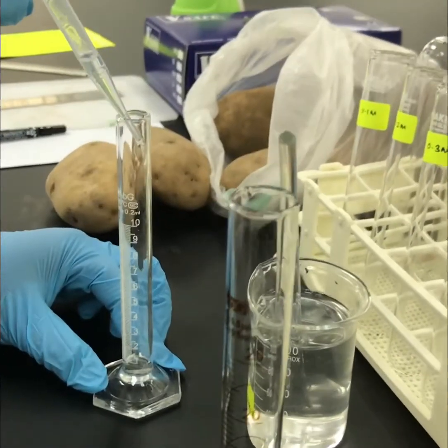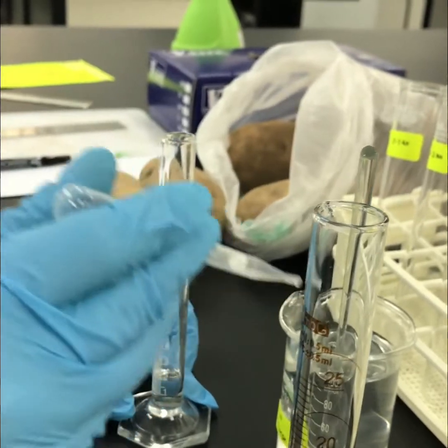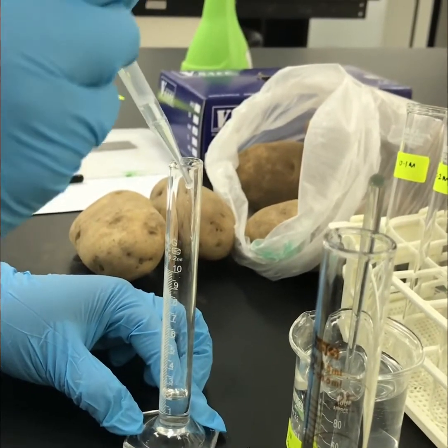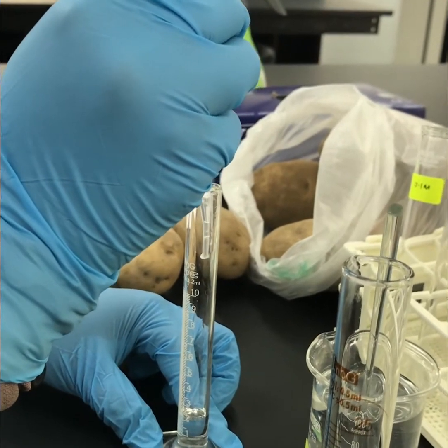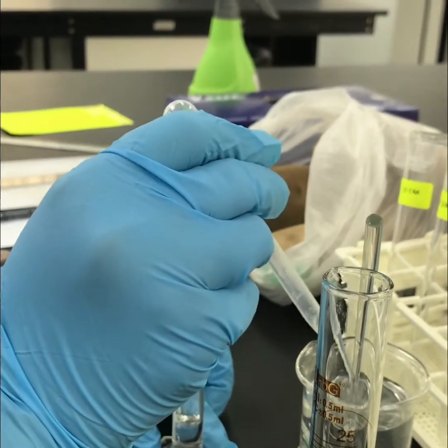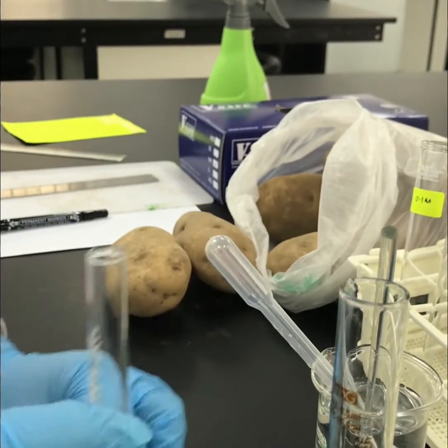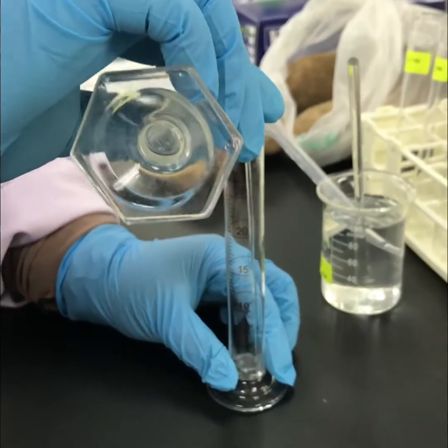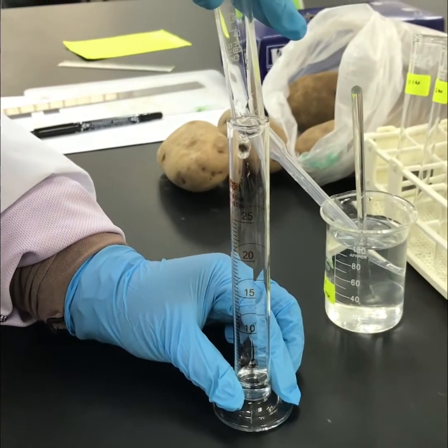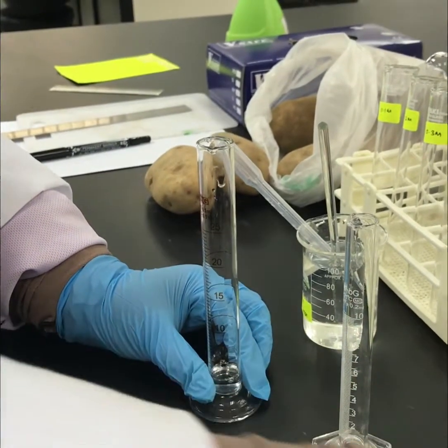Okay, next, you have to prepare 20 ml of sucrose solution with different molarities in boiling tubes using the dilution method. The molarities required are 0.1, 0.2, 0.3, 0.4 and 0.5 molar. Record the volume of sucrose solution and the distilled water used in table 3.1.